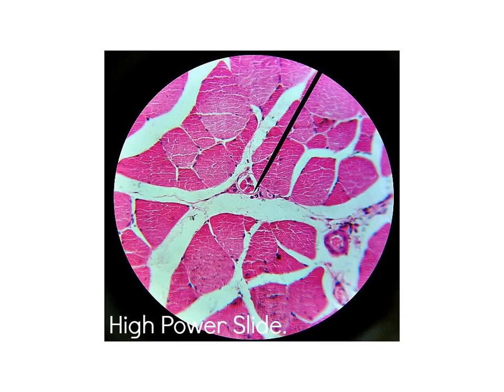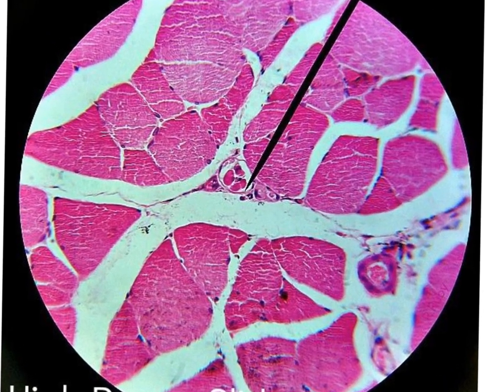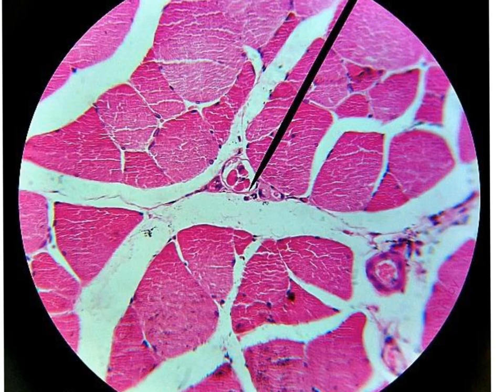This is the third slide in the high power. It is also for a nerve ending. As you see here, we have this small capsulated structure, this red capsule, and inside it we have a white space, and inside also we have a few red fibers. These are the intrafusal muscle fibers. Outside this nerve ending, we can see transversely cut skeletal muscle fibers.